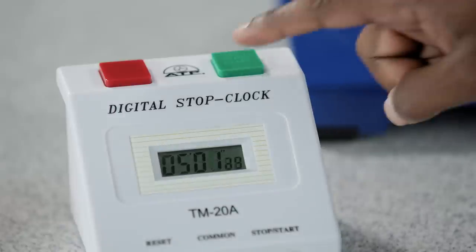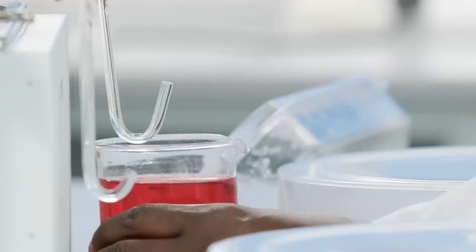After five minutes, hold the beaker of colored liquid to the ends of the capillary tubes so that the liquid enters.